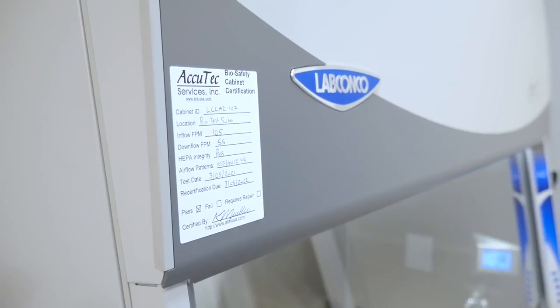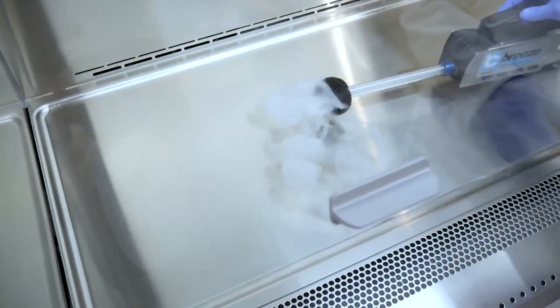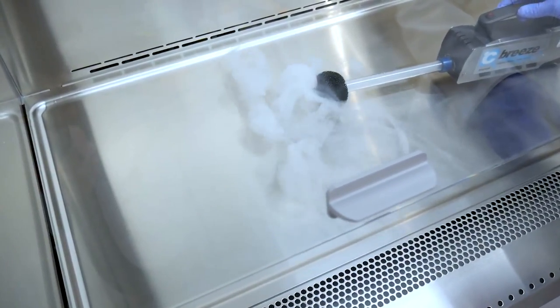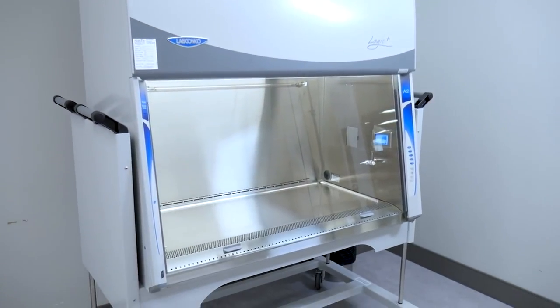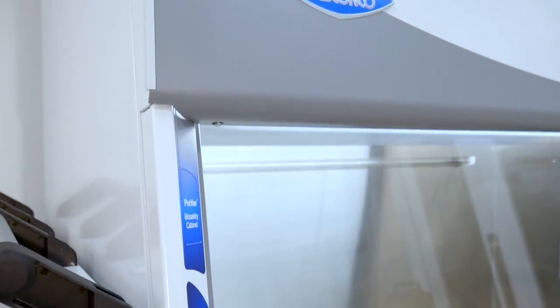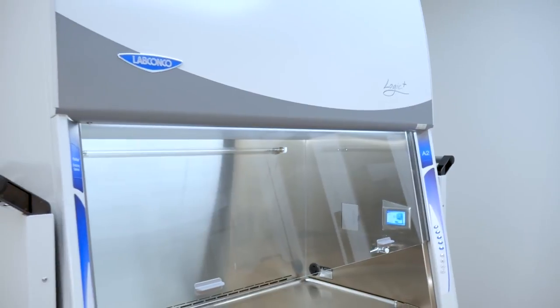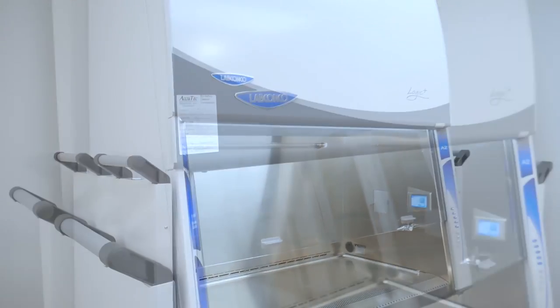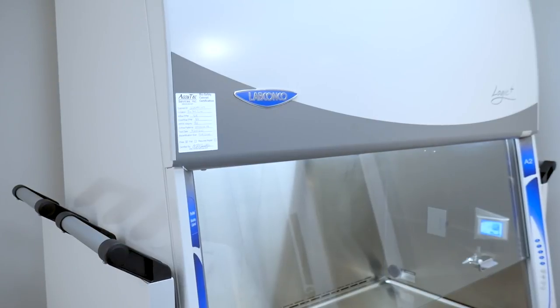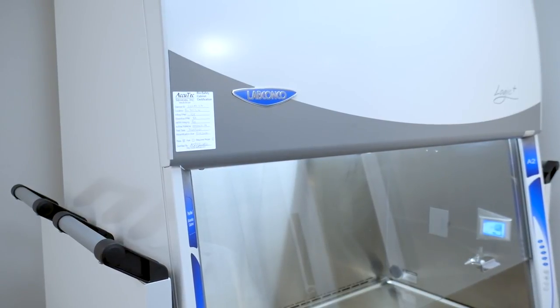The process of certification ensures that cabinet air flows are correct and that the internal filters are free of leaks. A BSC must be certified after installation, then at least once per year thereafter. Biosafety cabinets must also be recertified if they have been moved or if major service has been performed. Contact your lab manager or biosafety officer if the certification is lapsed.